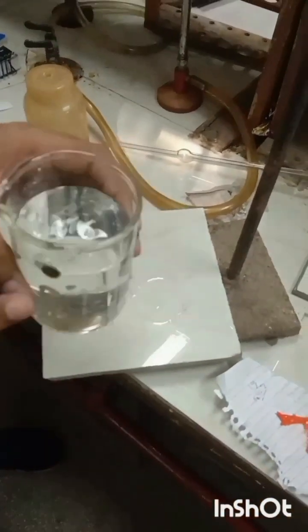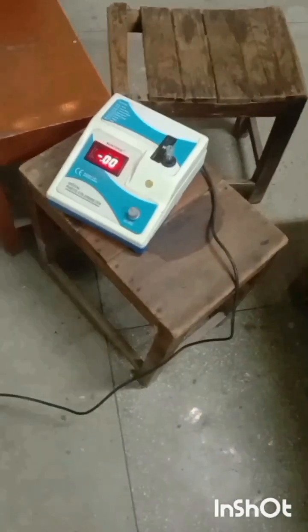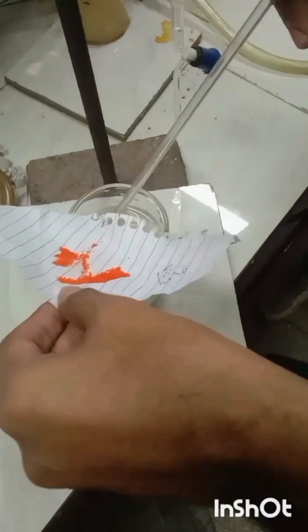First we will prepare a 0.1 normal solution. For that we will take 4.903 grams of potassium dichromate, add it into a beaker containing 200 ml of distilled water, and constantly stir it with the help of a glass rod to prepare a clear solution.